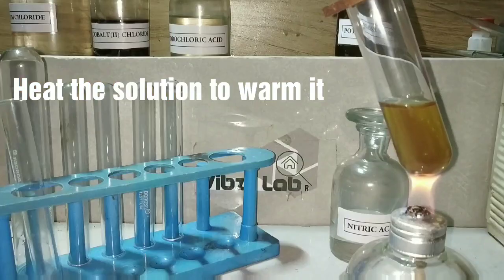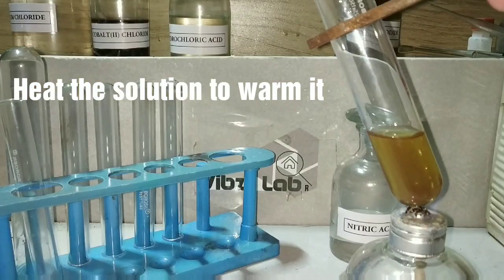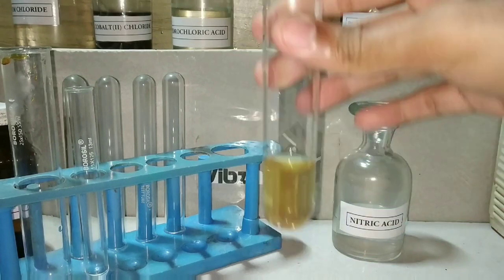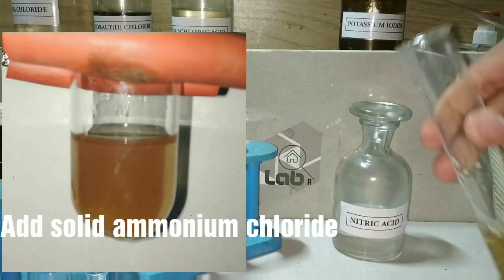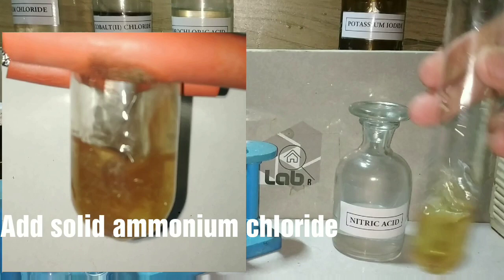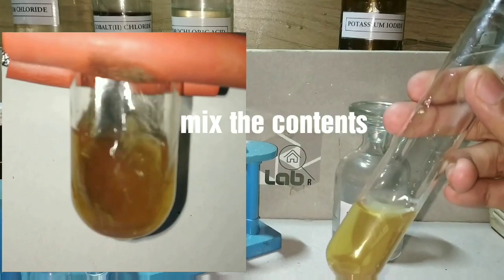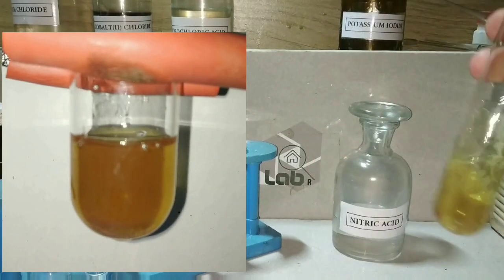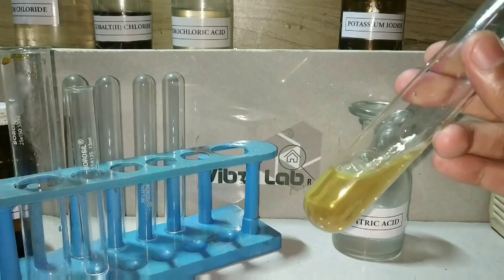We first gently heat the solution to warm it. After cooling it, we will be adding solid ammonium chloride, then we mix the content so that the ammonium chloride dissolves in it. The next step is to add the ammonium hydroxide solution.